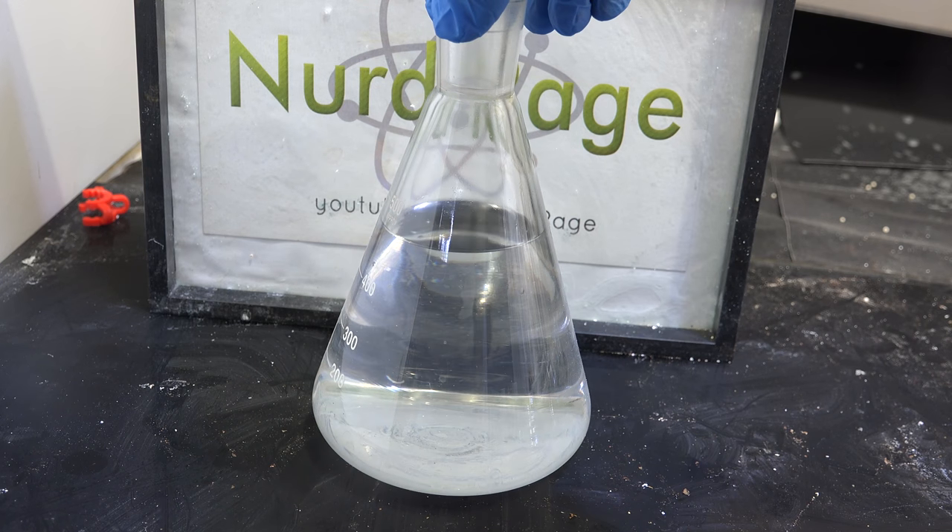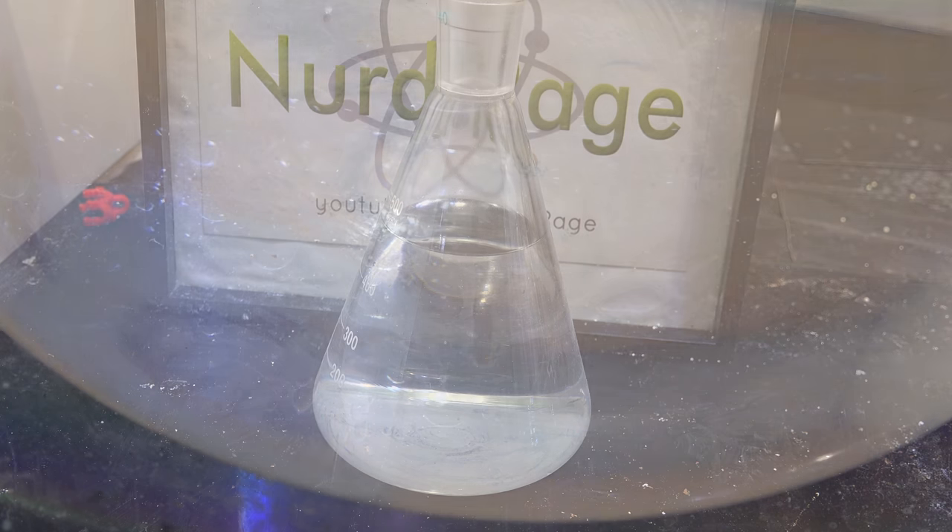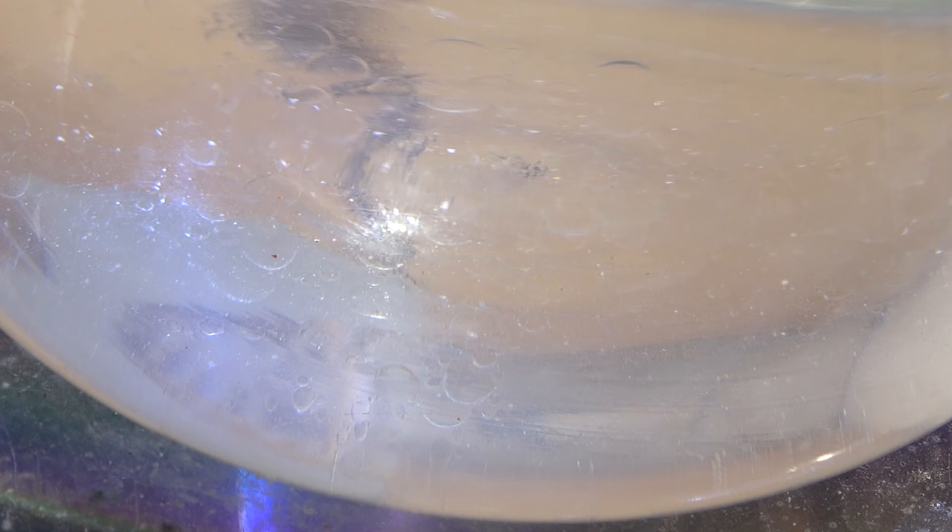This particular batch has been recovered from multiple experiments, so it's full of impurities including water, organic peroxides, small amounts of alcohols, esters, halogenated compounds, acids, and so on. In fact, if you look at it very carefully you can see droplets of water in the bottom. As you can see, this is not a good solvent and would certainly ruin our Grignard reactions if we used it.